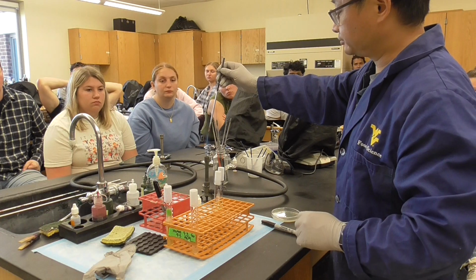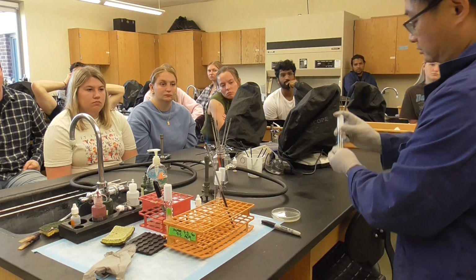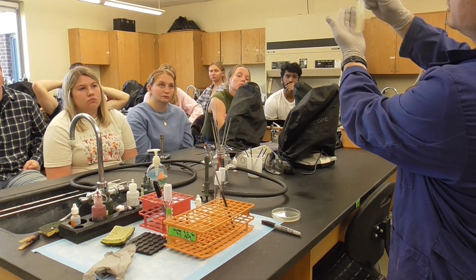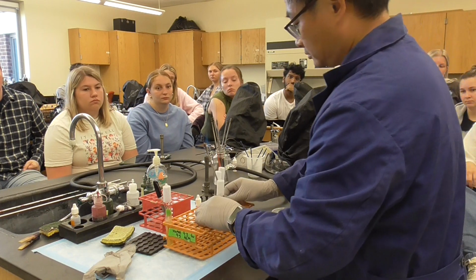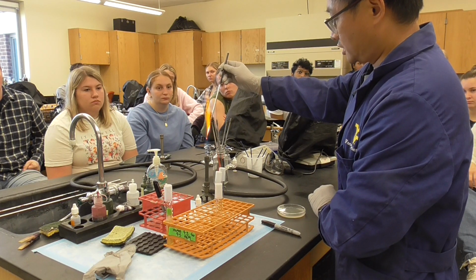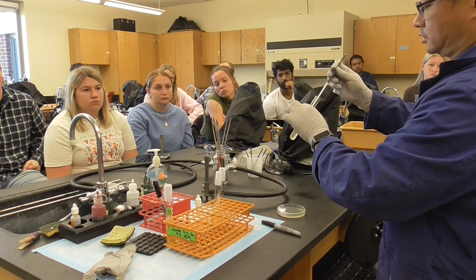Flame your loop again. First, make sure the Bacillus is gone. Now, this one, make sure you shake it. Make sure you shake it very well. I will shake 15 seconds, because a lot of them are at the bottom. So flame your loop again. Okay. Now, hold on. Go to the broth.